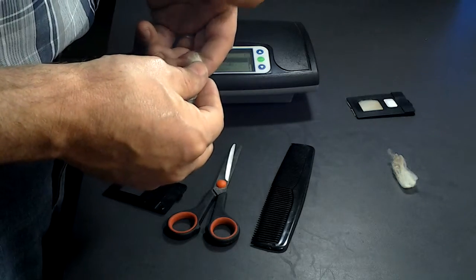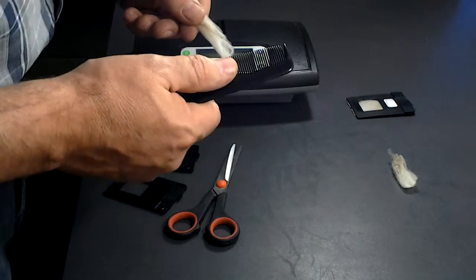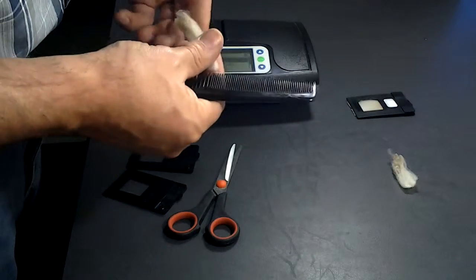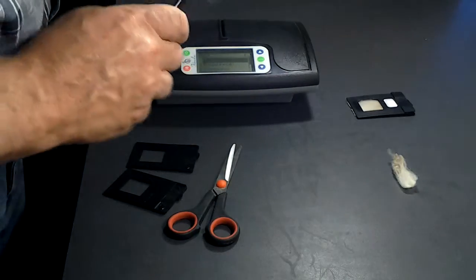Hold it on the dirty end and then take the fine side of the comb and pull it through until most of the wrinkle is out.